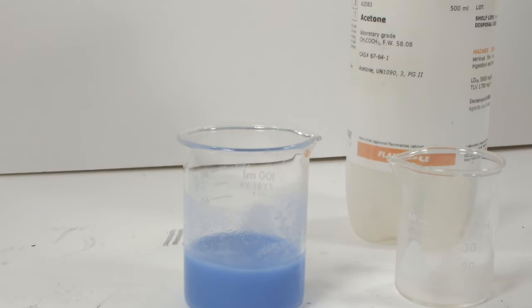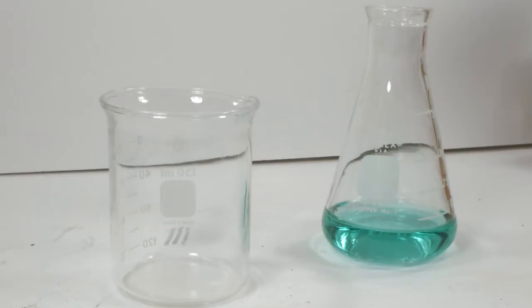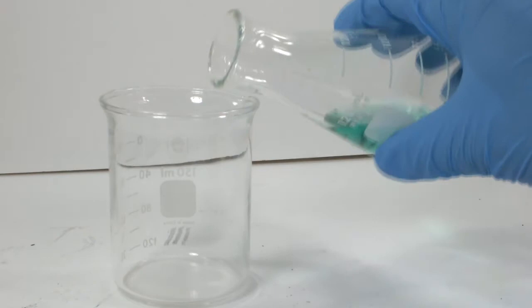Fortunately, this precipitate settles pretty quickly, and that's helpful. After letting it settle for just a little bit, I would add more acetone. If new precipitate formed, I would keep adding acetone. Once I saw that no new precipitate formed, enough had been added, and it's time to put it back in the fridge to settle completely. I used about 20 milliliters of acetone.